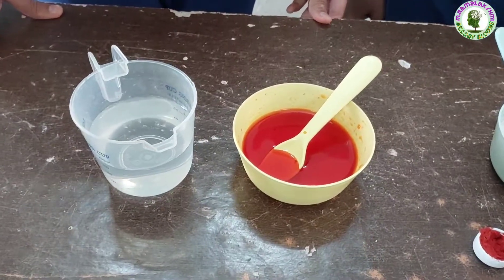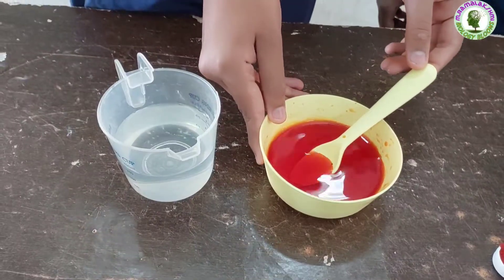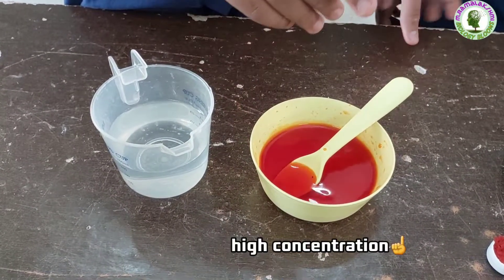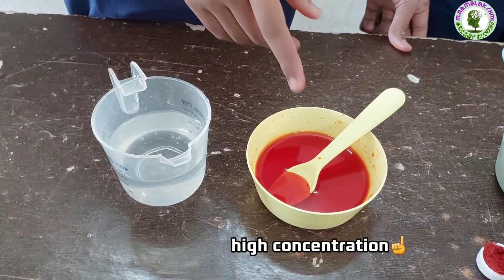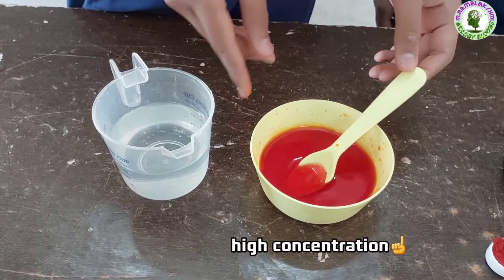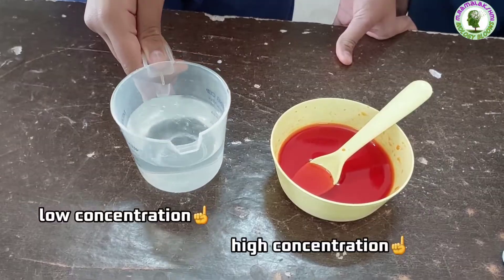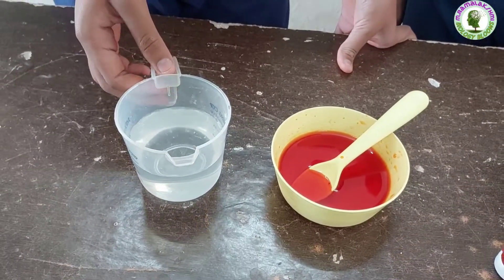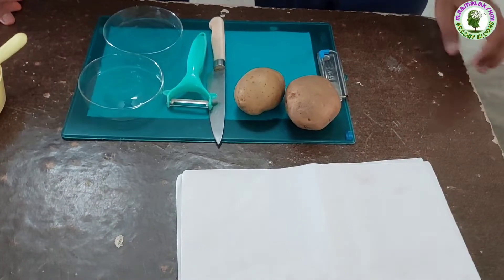Children, do you know which is the high concentrated solution of these two? Saturated sugar solution, ma'am. Why? Because it has more solute, that is sugar, in it. So sugar solution is the high concentrated solution. What about the water? It is the low concentrated solution. Good children. Now peel the potatoes and make potato cups.